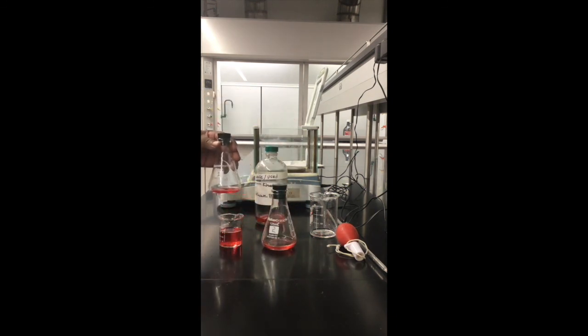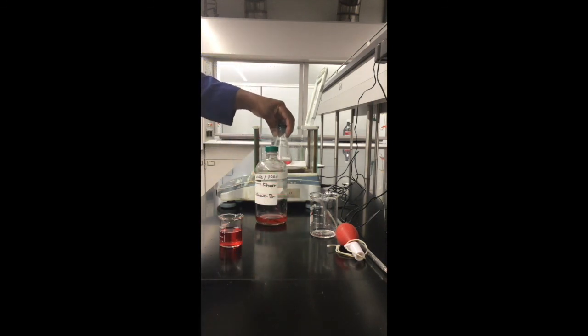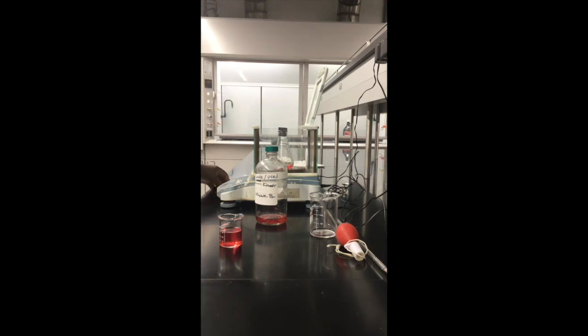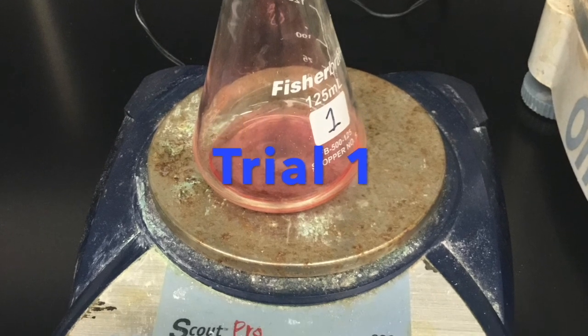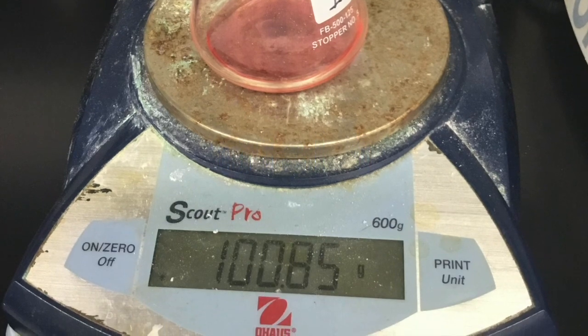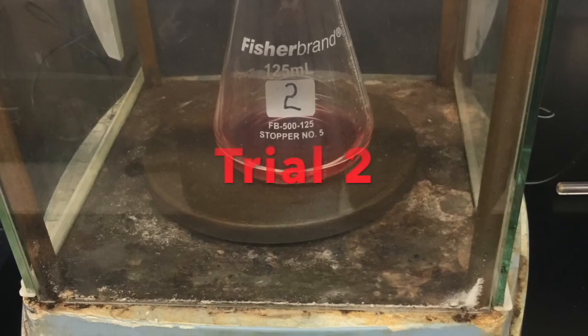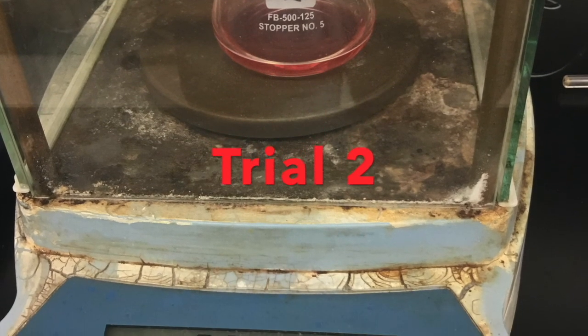Record the masses in the correct columns: trial 1 for centigram and trial 2 for milligram. Find the average following the rules for addition with respect to maintaining the correct number of significant figures.